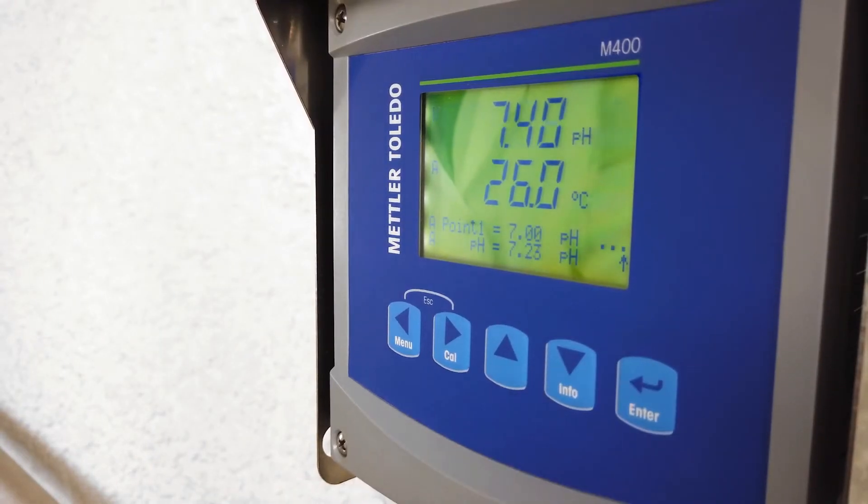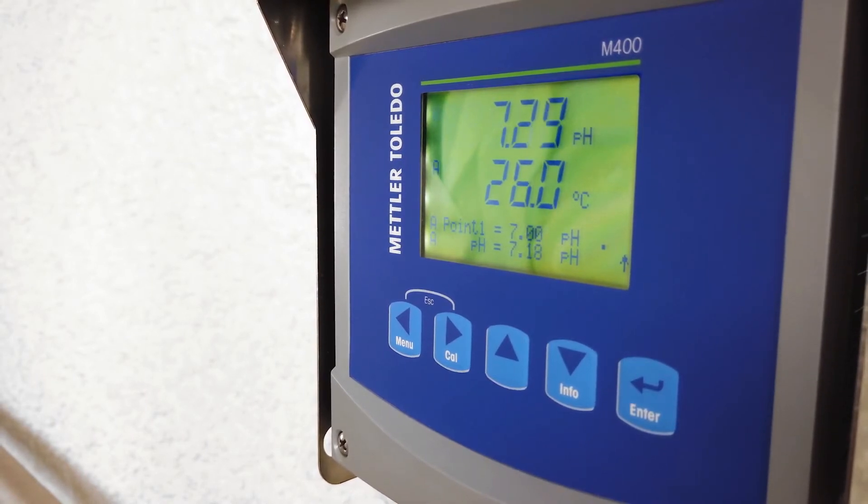Press the enter button, and on the screen you will see that it's detected pH 7 buffer and it's calibrating the first point.